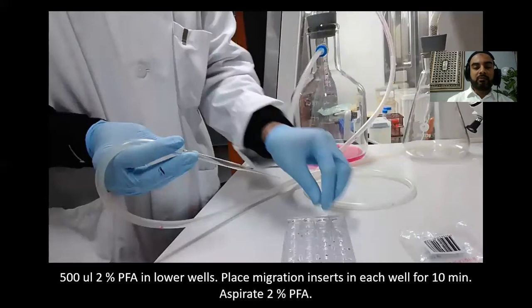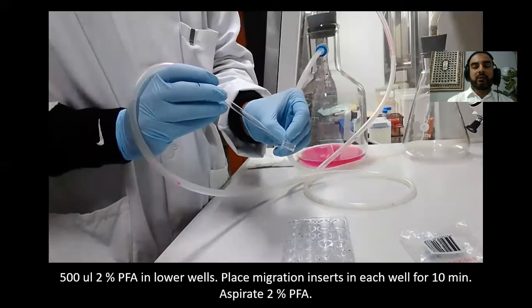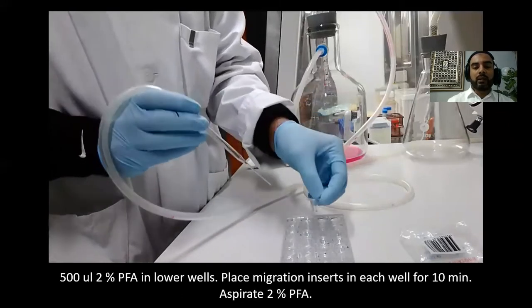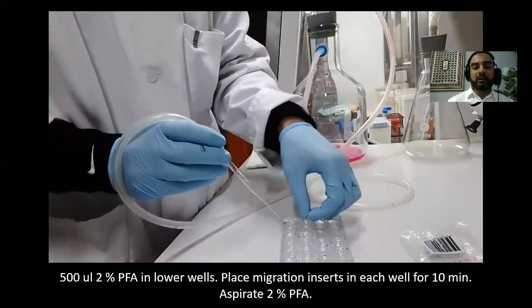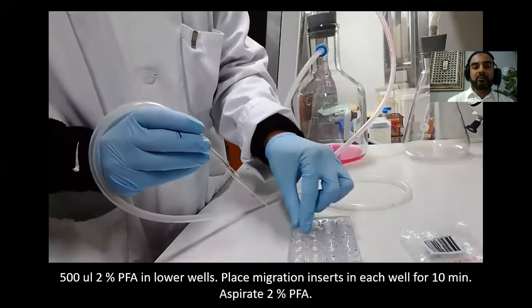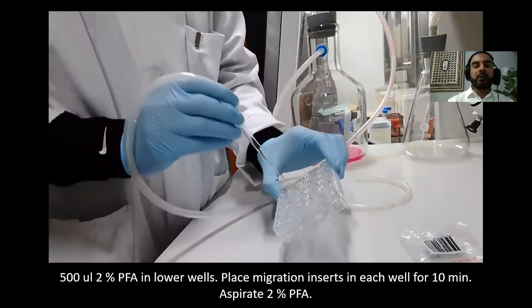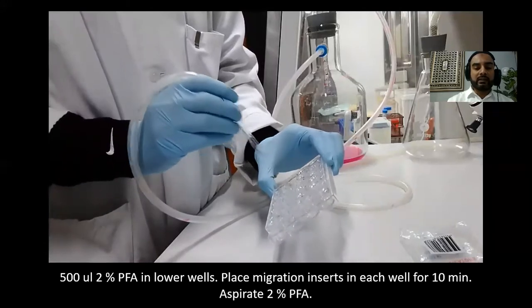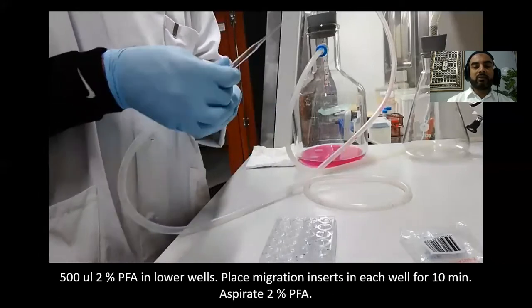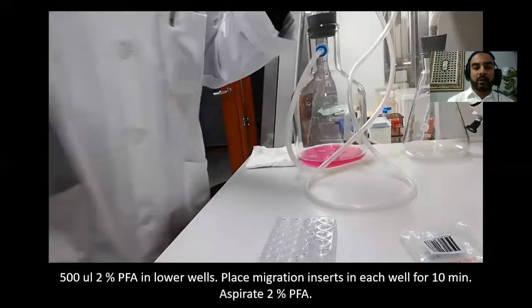We have 500 microliters of 2% paraformaldehyde — a fixative — in the lower wells, and we incubated for 10 minutes. Now I'm aspirating the 2% PFA. The cells are now fixed on the bottom of the membrane. The migrated cells are on the underside of the membrane — this step was the fixation of the migrated cells.